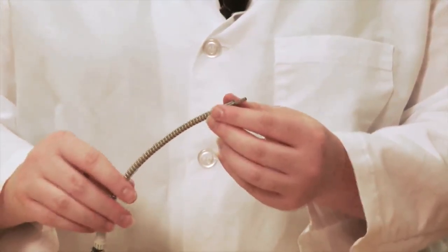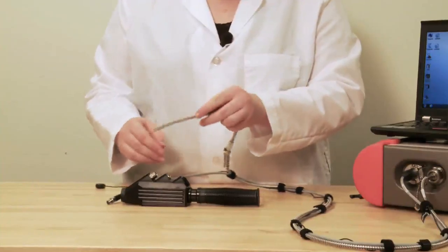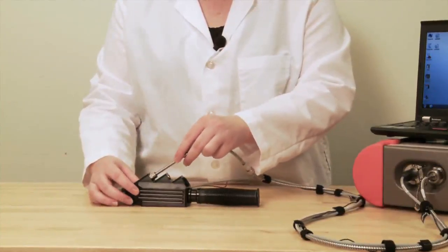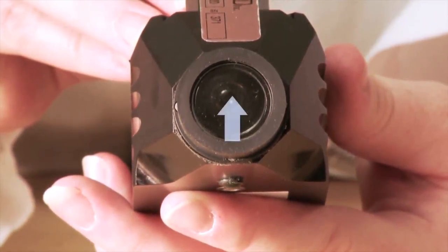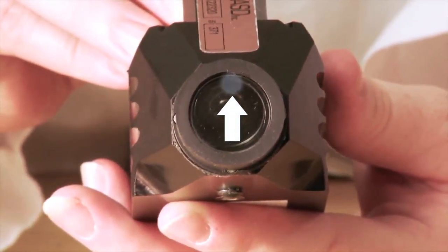Slide the end of the fiber optic cable into the connector on the contact probe. Be sure that the fiber optic cable is fully inserted by holding the cable in place and also checking the window on the front of the contact probe.